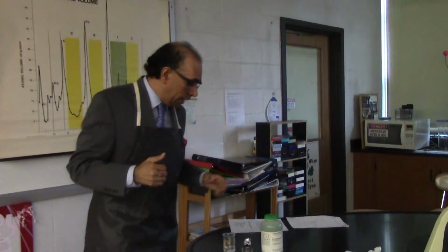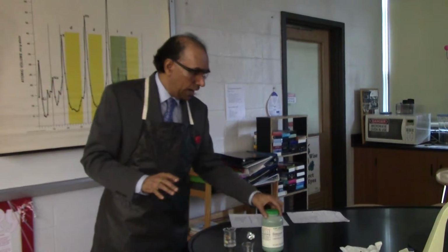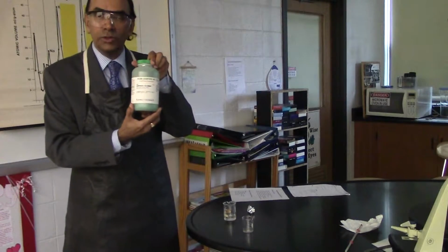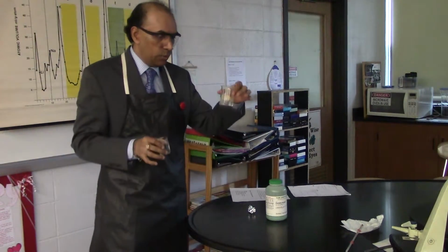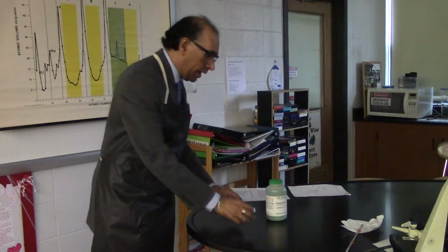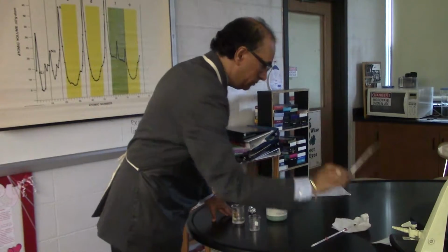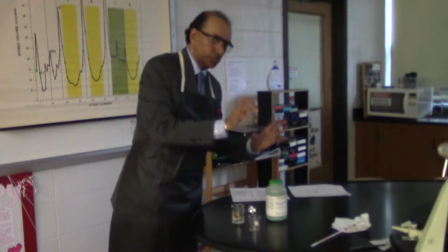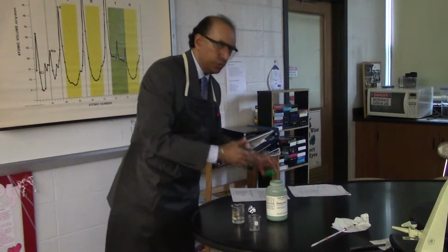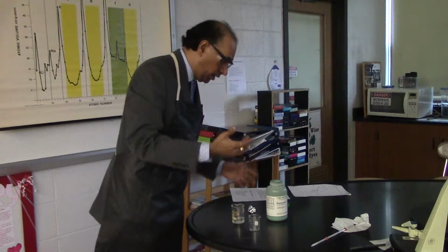So here we go. I do have with me aluminum foil, loosely crumpled. I have copper 2 chloride dihydrate. I have two beakers. One is empty at the moment, and one has some tap water. And I have my thermometer, and I have a scoopula. Okay. So we're going to start off the experiment. I'm going to create 4 systems, and if you know from the Next Generation Science Standards, you should be able to define what is a system and what the boundaries of the system are.